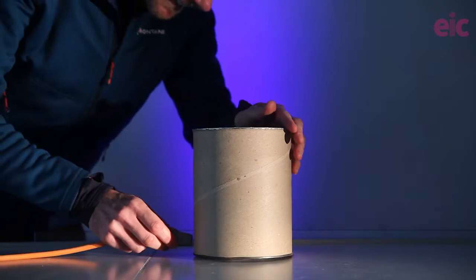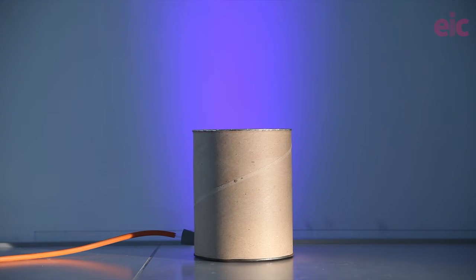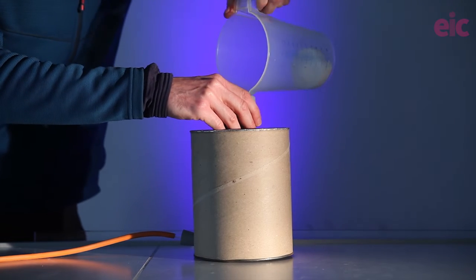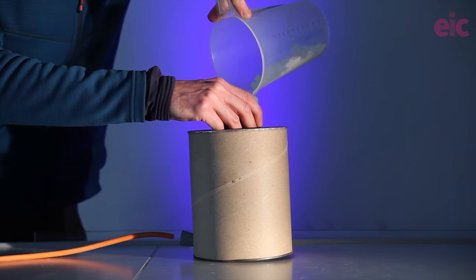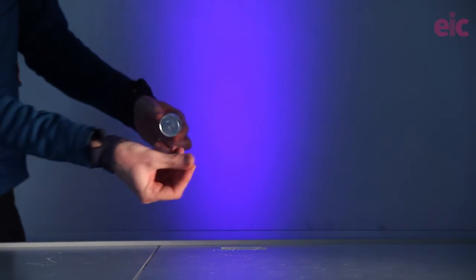A spoon is invaluable to load the powder over the end of the tubing inside the tin, and if you miss it can be used to shape the powder pile. A pipe like this to deliver the powder makes things even easier. I keep a number of spare candles to hand just in case the candle gets gunked up by sugar.